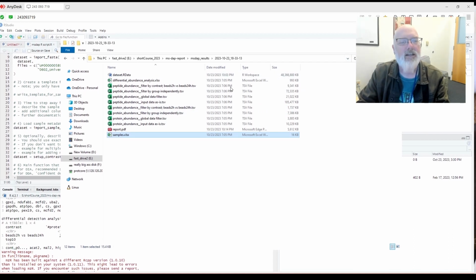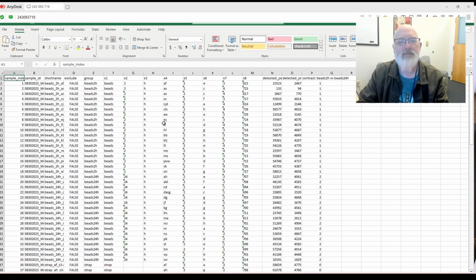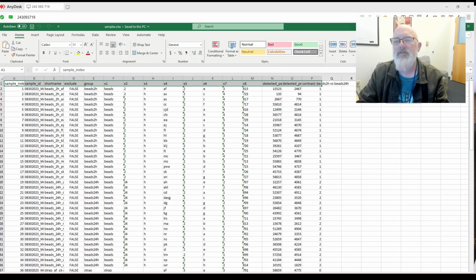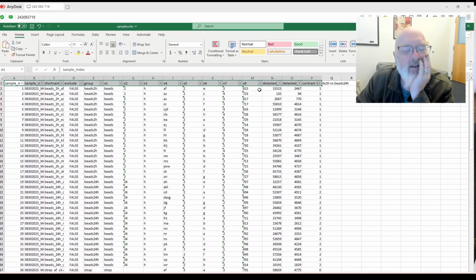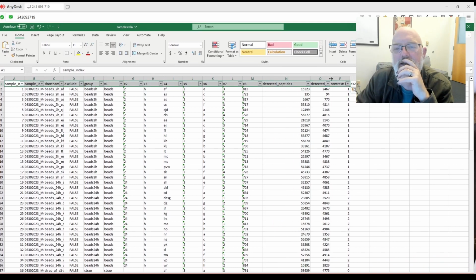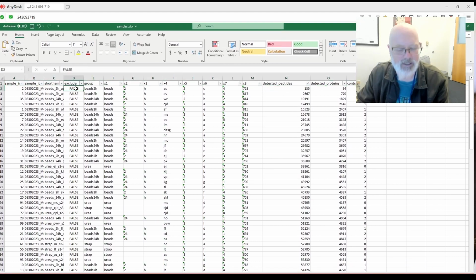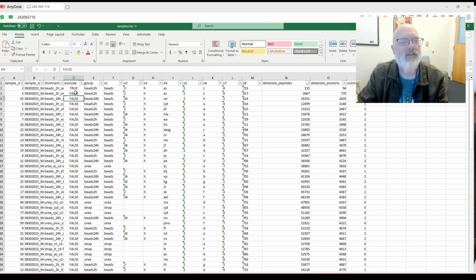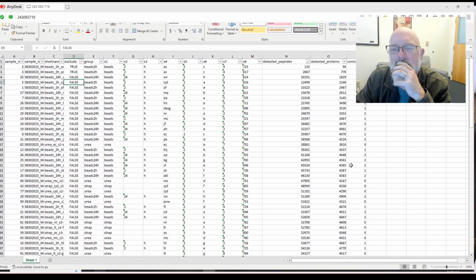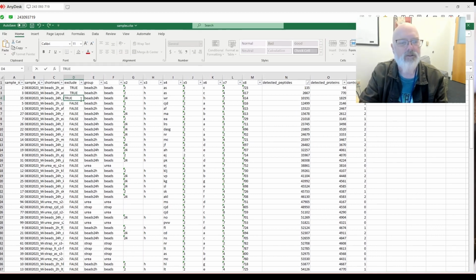I'm really loving it. So what I would do next is we could go into samples, for example, and we could filter, and then look at the number of detected peptides, and sort by smallest first, largest. You could see this is obviously an outlier, so we could change this to true. And this might not be the best approach, but we're just playing around with it right now. So maybe we'll go true.